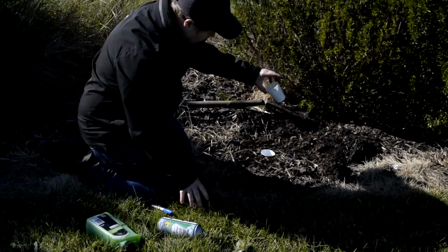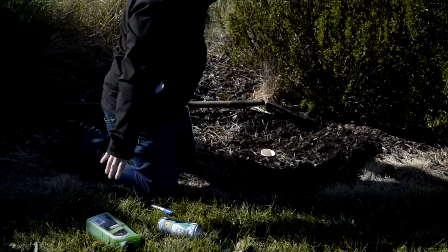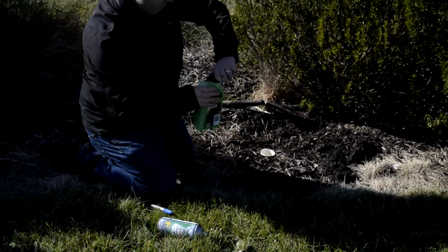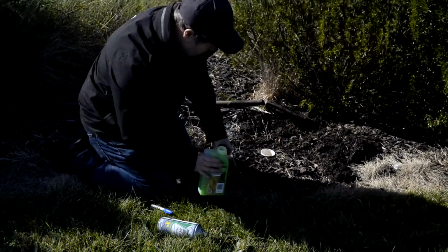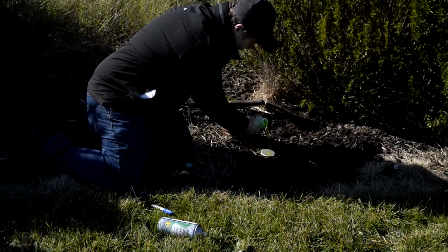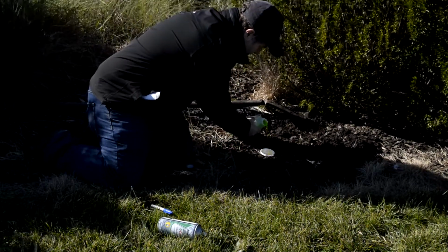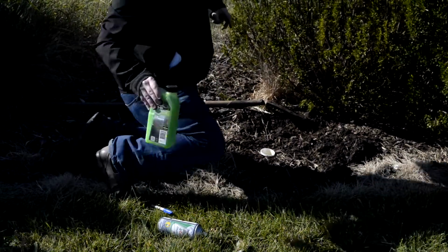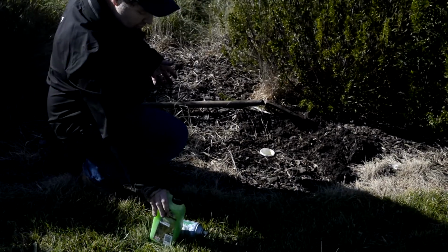And once you've got that, you can then put that back in to the sheath, and then it's just a matter of filling up maybe to a third of the way up into the cup with some preservative. You don't need too much, just enough to ensure that any insects that do fall in are covered by that preservative.